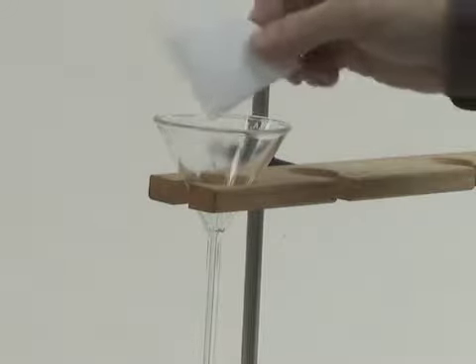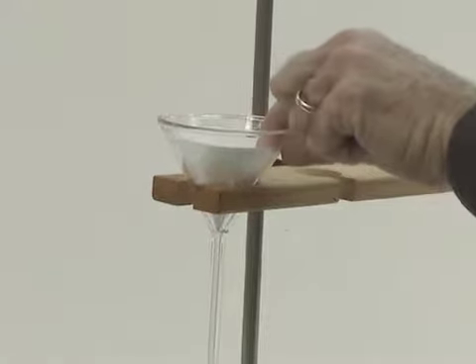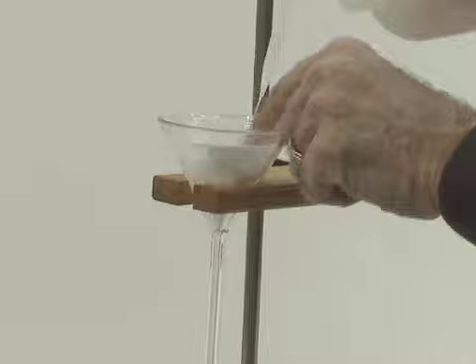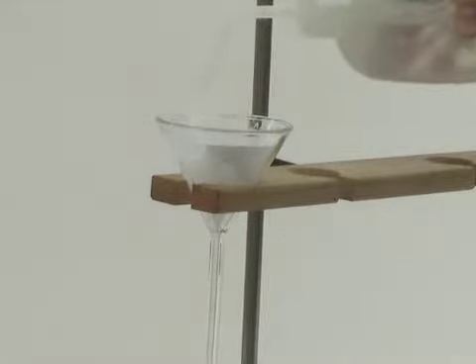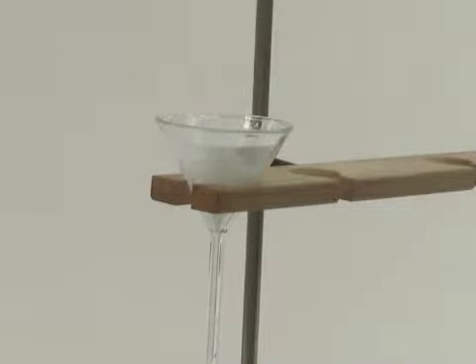Place the cone into the long stem funnel. Spread out the cone in the funnel and wet it down with some deionized water from your wash bottle. Press the edges of the filter paper against the glass funnel. You want to make sure that you have a good airtight seal around the top of the filter paper.